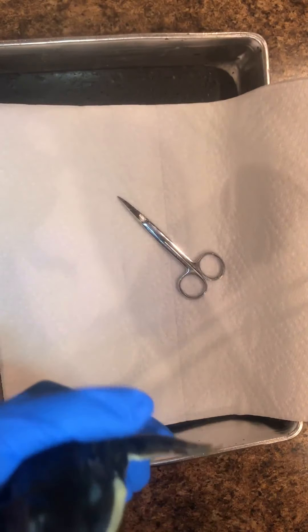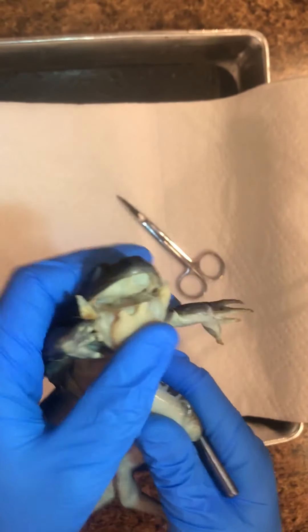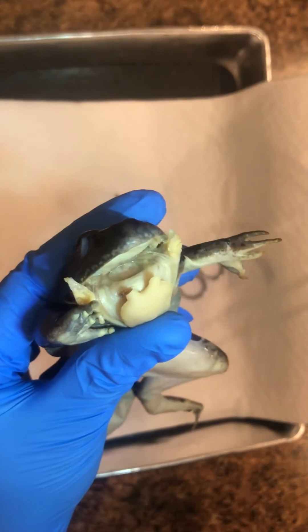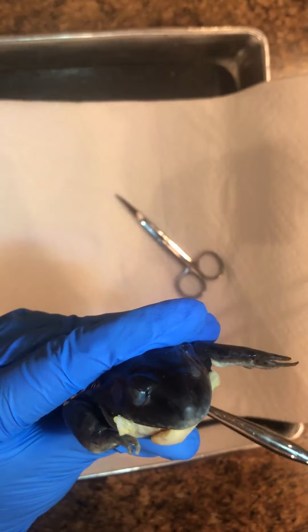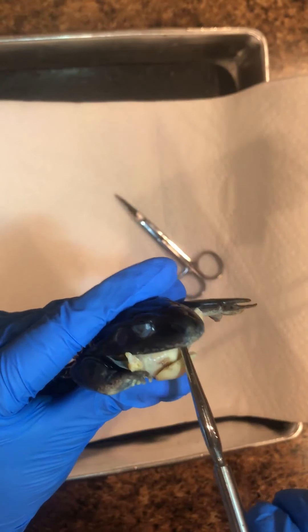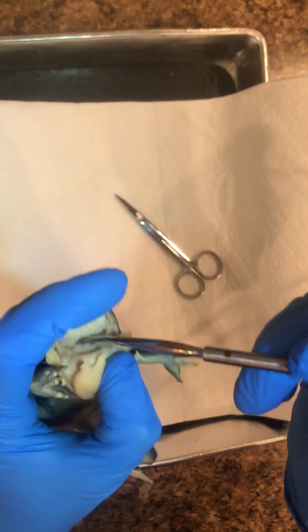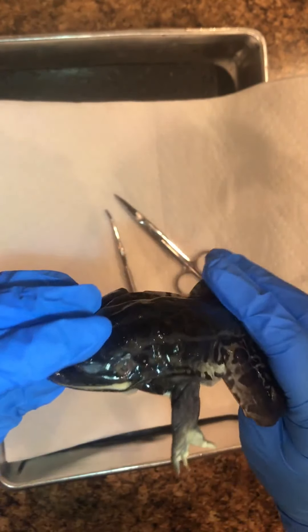There is a slit-like opening here called the glottis, which leads to the lungs. Right behind the glottis is the esophagus — I'm opening it up more and you can actually see some food in there. The esophagus carries food from the mouth to the stomach. That's pretty much the full mouth anatomy.